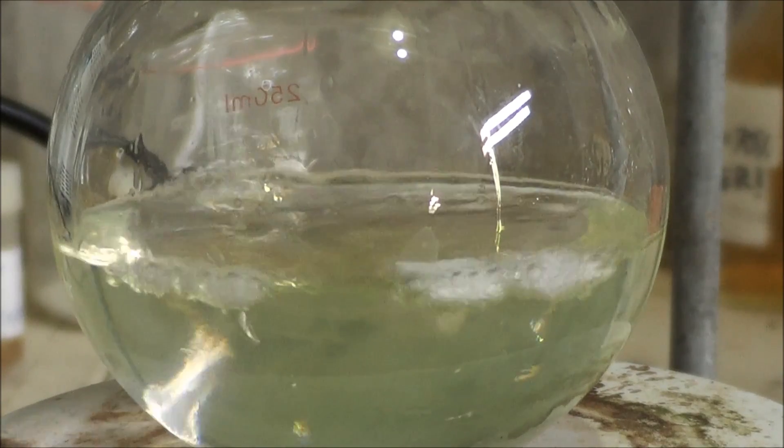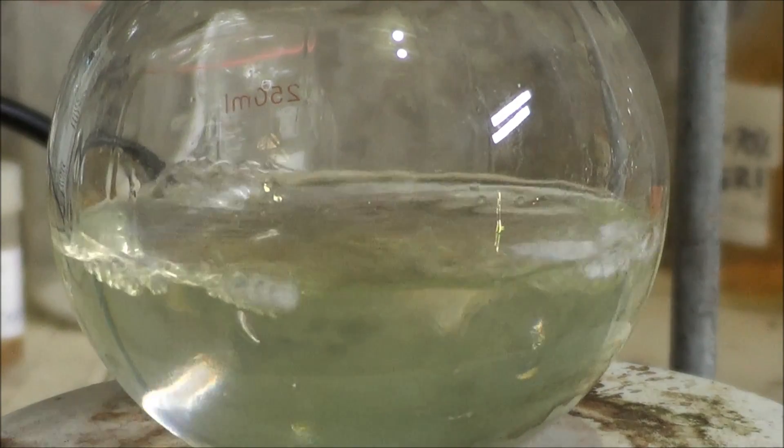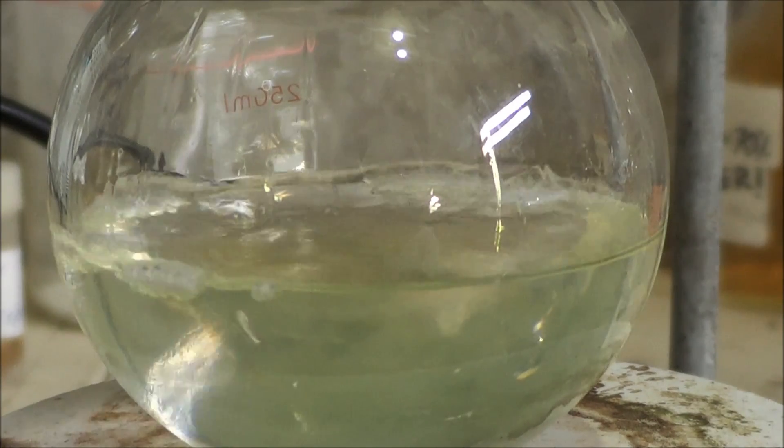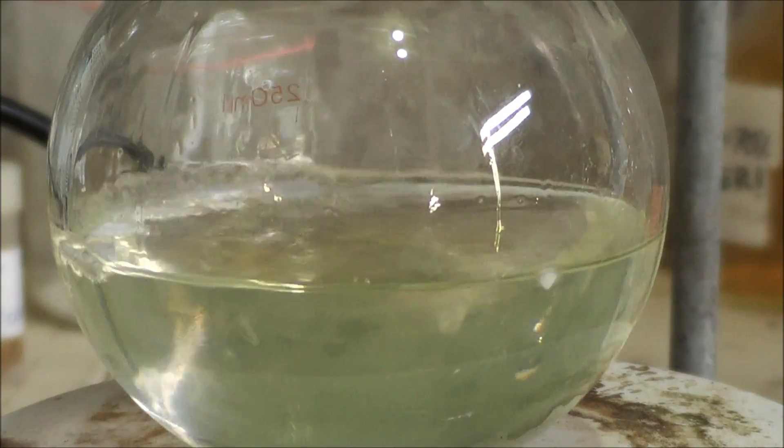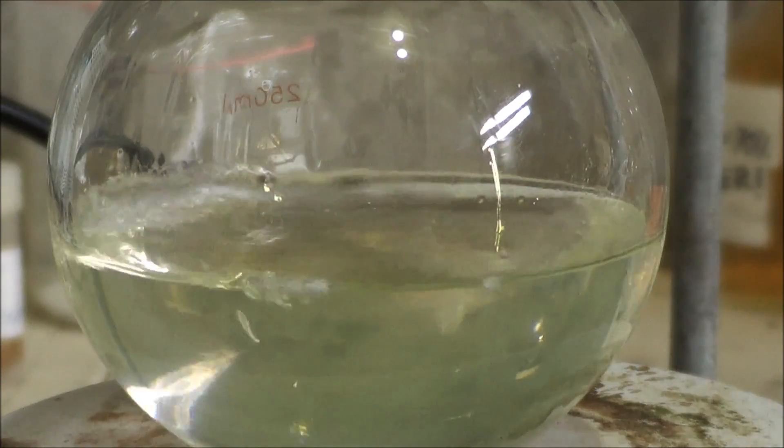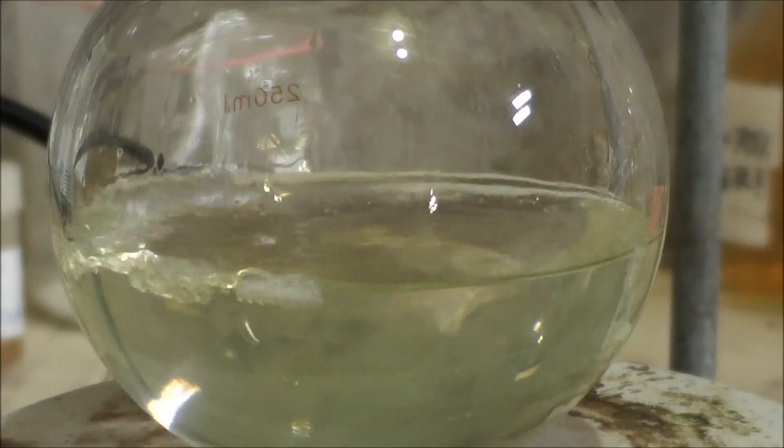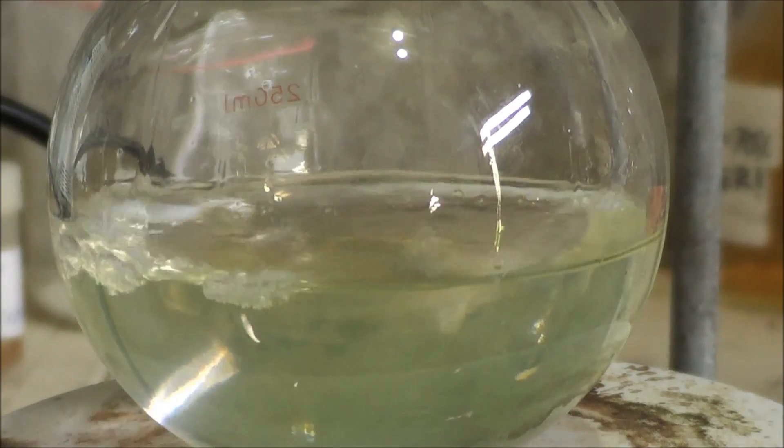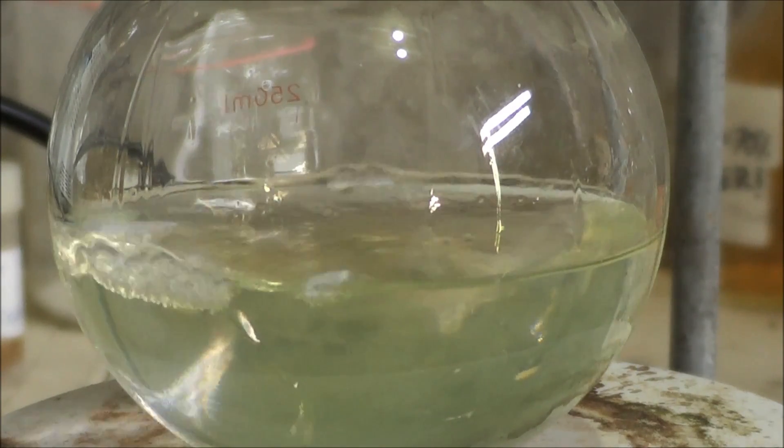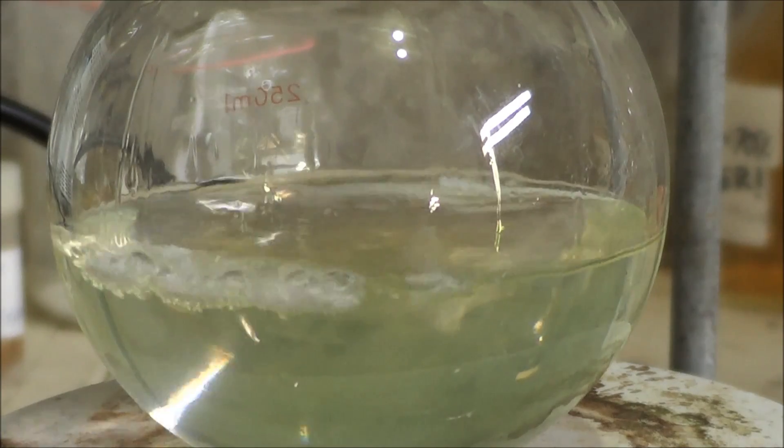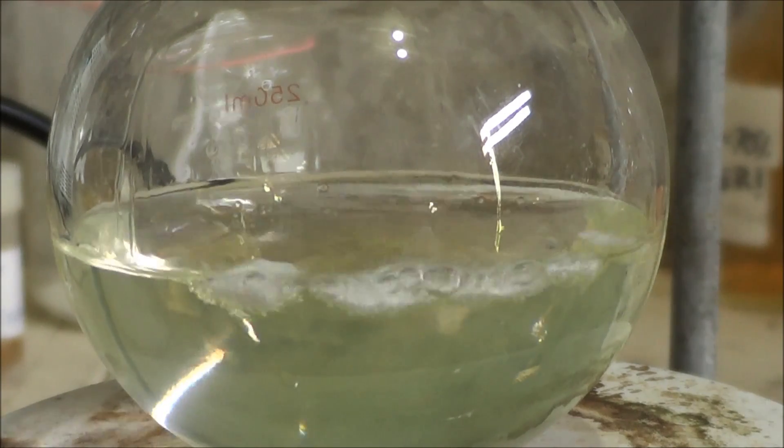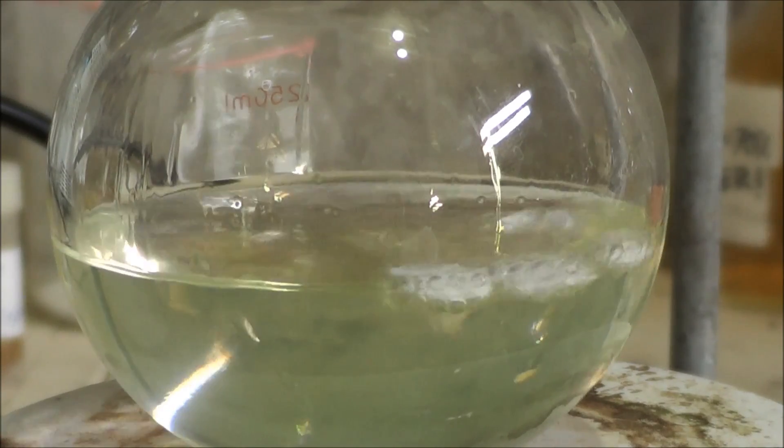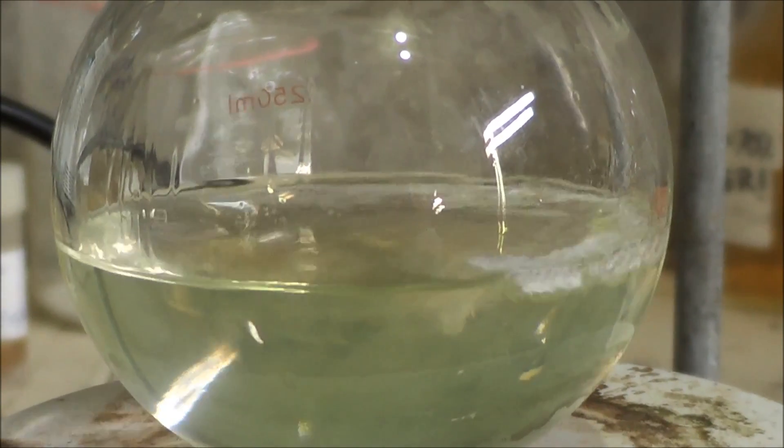Okay, it's only been five minutes and you can see quite a majority of the sodium has reacted. I think some of the ethanol did escape the condenser in the end, or the beginning, just because it got so hot and my condenser couldn't keep them all in, because there was a bit of an ethanol smell. So making sure I don't smoke any cigarettes around here for the next little while, or turn on the hot plate, or anything like that, and we should be fine.